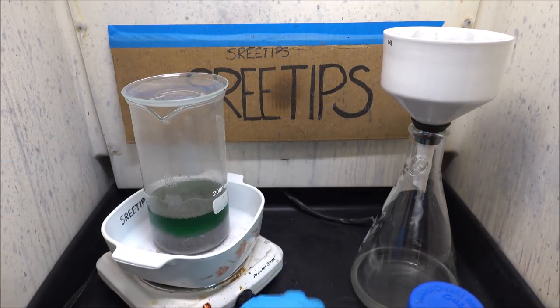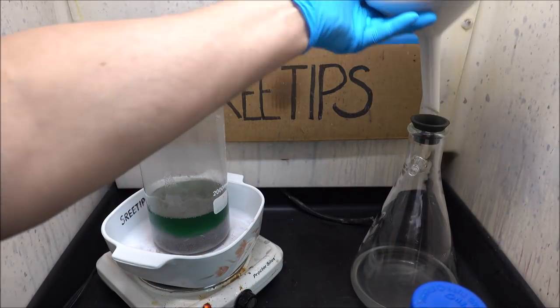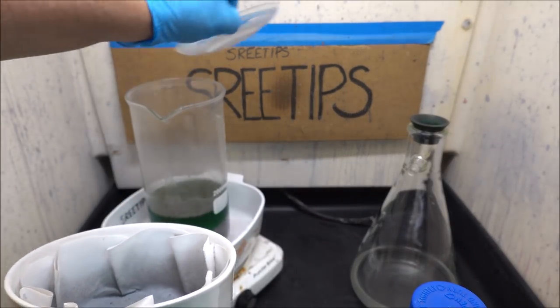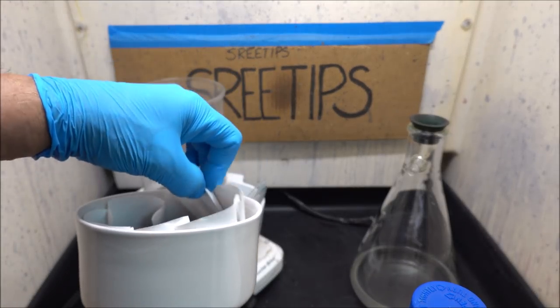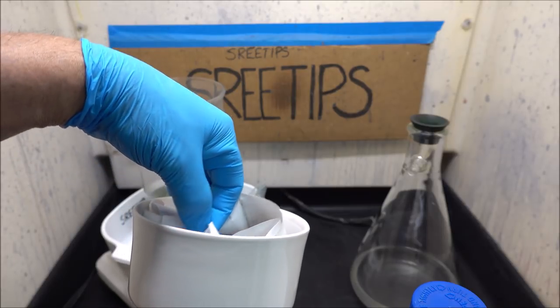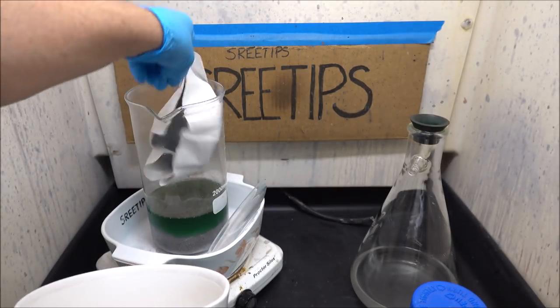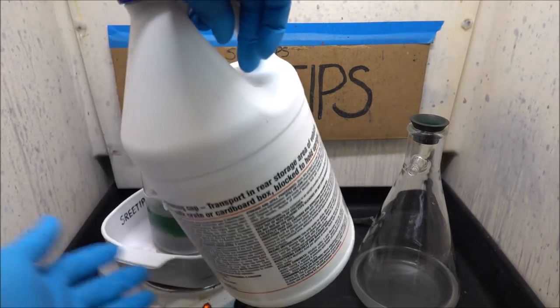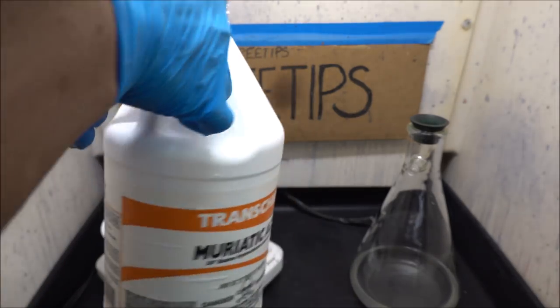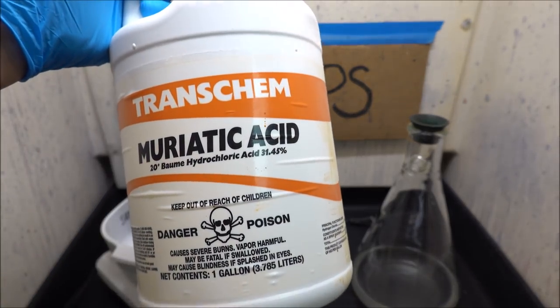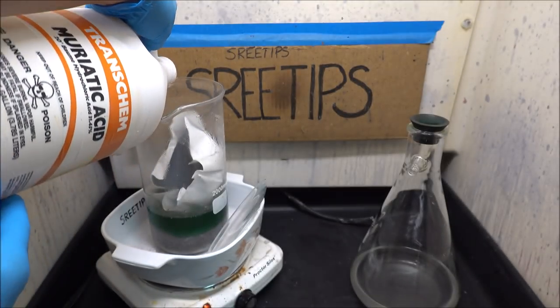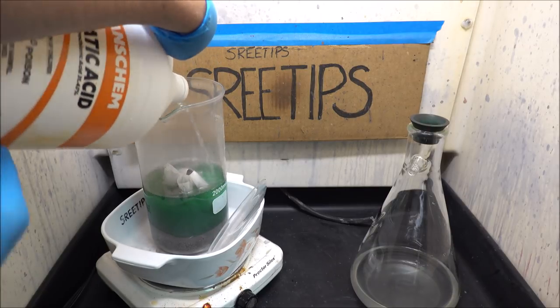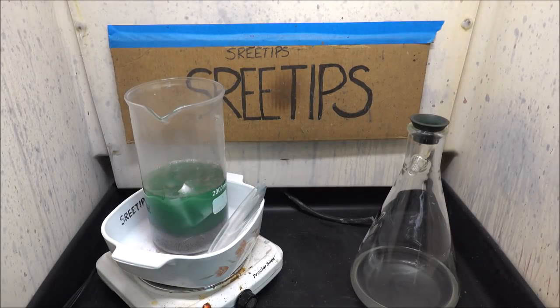Our solution has been filtered off over here. I don't know what's in here, so I'm going to add it back into the main batch here. Filtered paper and all. Then what I'm going to do, put a little bit more hydrochloric acid in here and just let this cook for a while. Let's see if I can get some more of these base metals removed before we hit it with aqua regia.